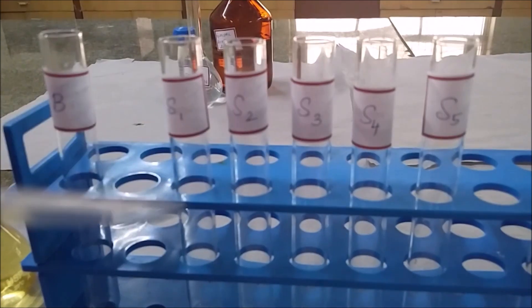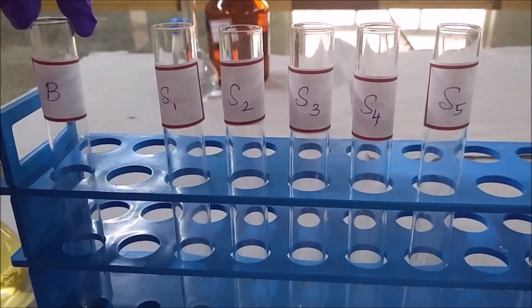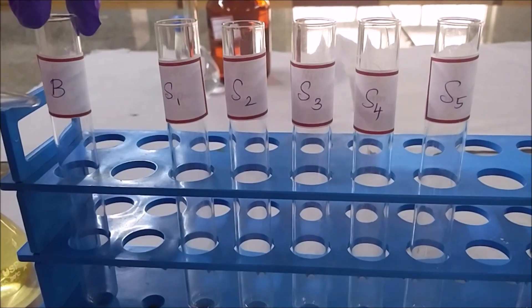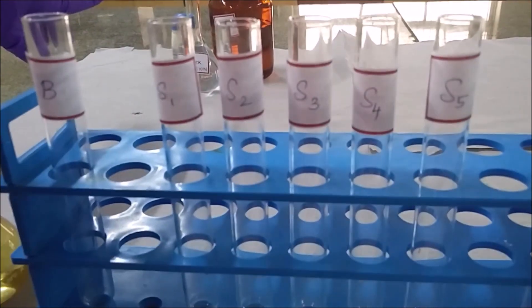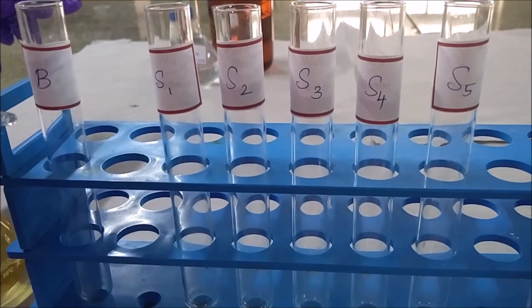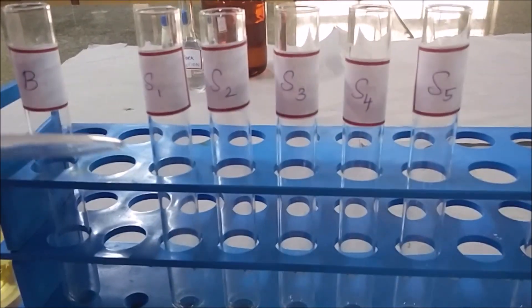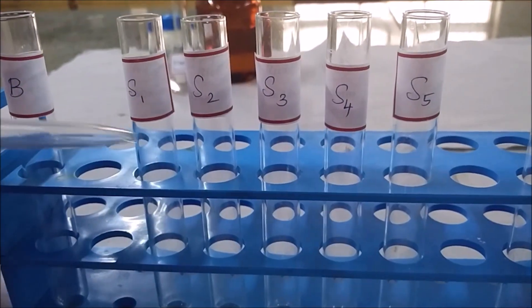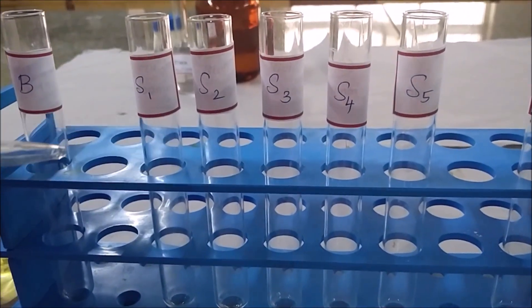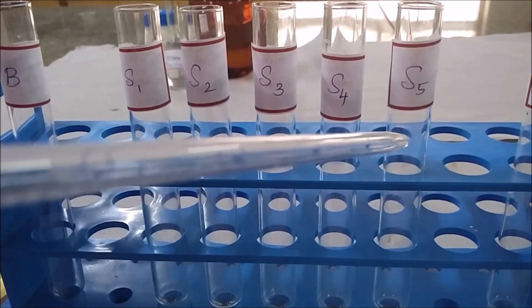In the protocol, take a series of test tubes to perform the experiment. The first tube is for the blank, which will contain only the ferric chloride acetic acid reagent. The next series of test tubes will contain the standard working solution at different concentrations, ranging from 0.5 to 2.5 ml.